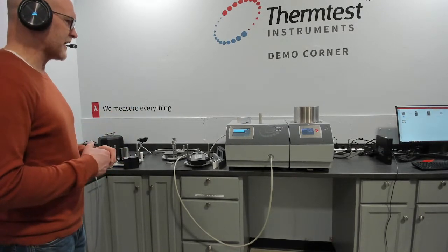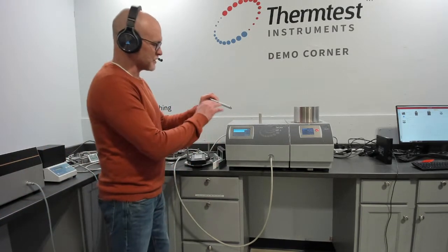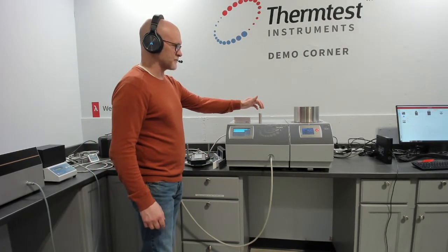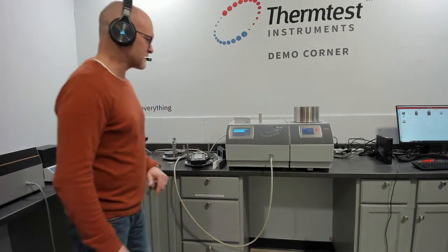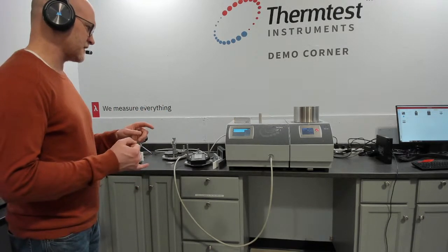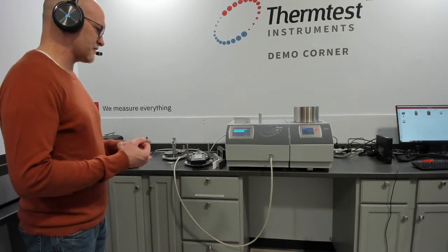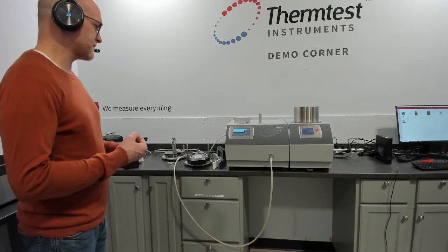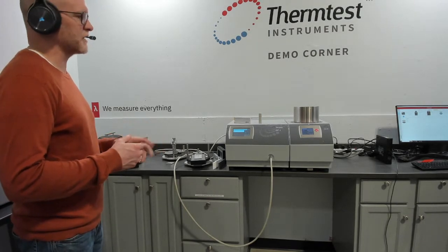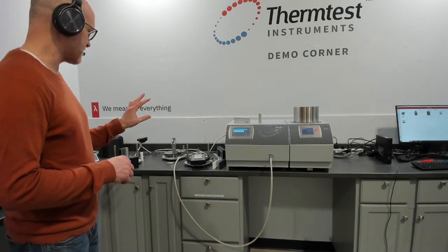heat. So the very fact that you have materials that are anisotropic, and what creates the anisotropy is the layers. Most of the pouch materials have multiple layers inside, and of course your cylinder battery has a jelly roll shape of layers. Those are not isotropic samples. So the volumetric specific heat that you can calculate from thermal conductivity and thermal diffusivity is not accurate anymore. You can only calculate specific heat from thermal conductivity and thermal diffusivity when your material is isotropic. So therefore you have to measure specific heat directly, and then that is an input into the measurement of anisotropy.